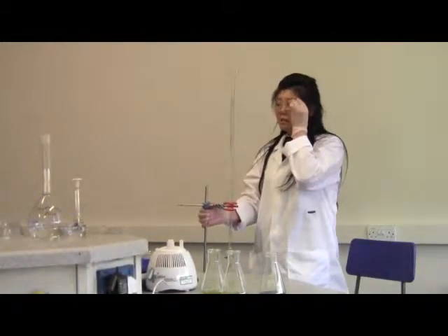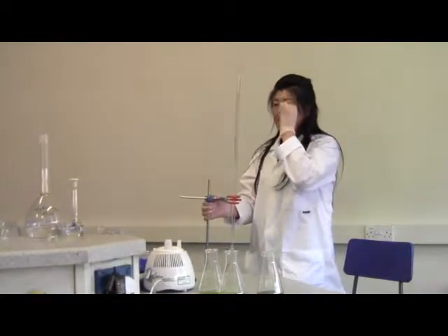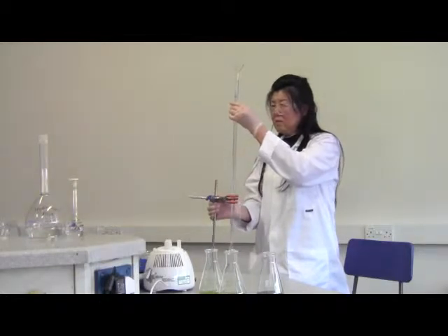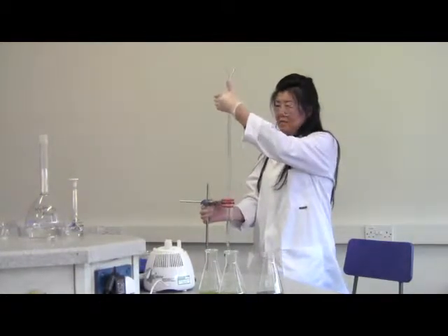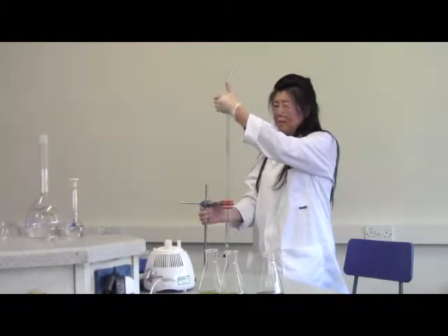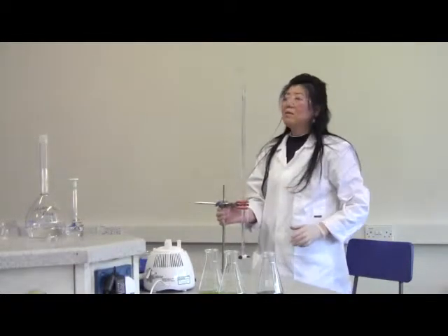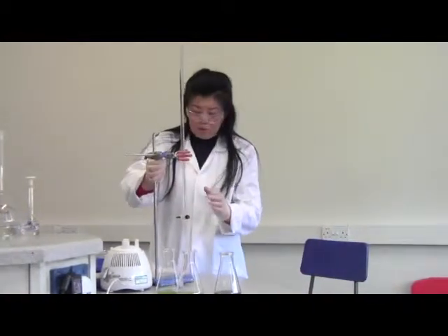So that is 1.95, okay, 1.95 volume I have used.